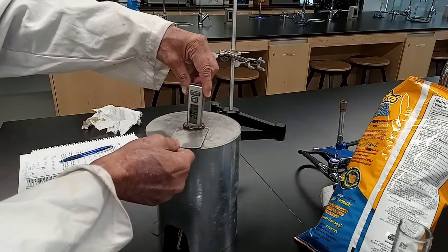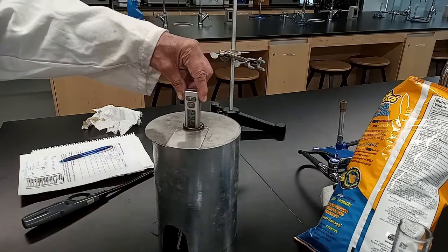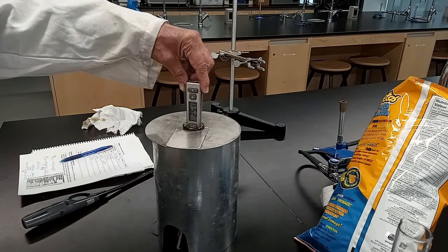Observe the highest temperature achieved and record the temperature as the final temperature.